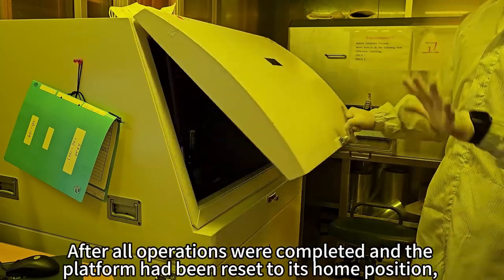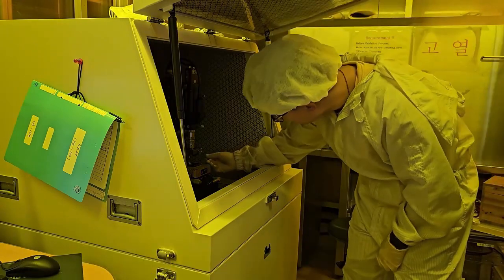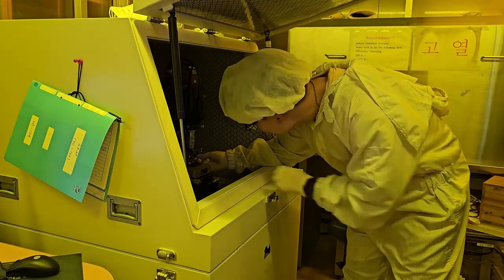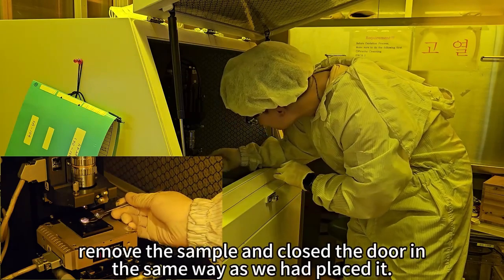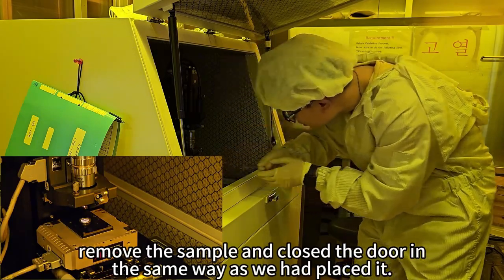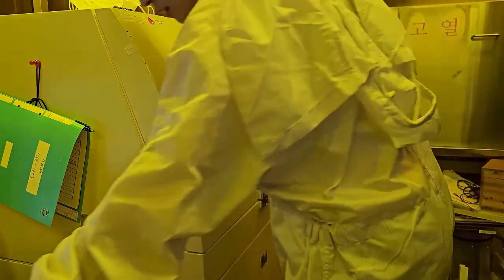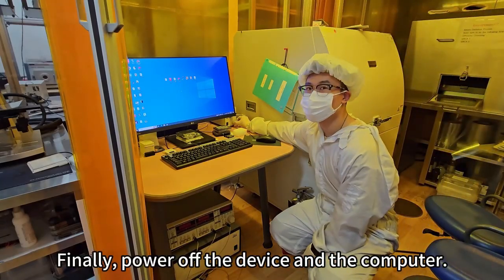After all operations are completed and the platform has been reset to its home position, remove the sample and close the door in the same way as we placed it. Finally, power off the device and the computer.